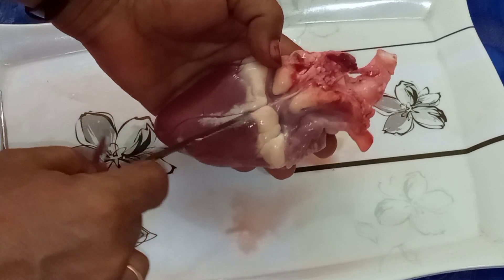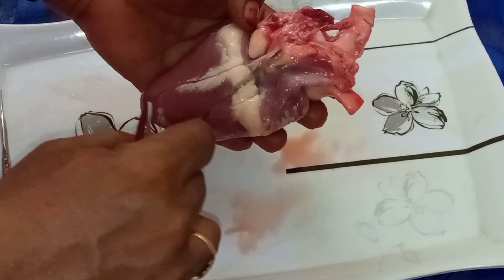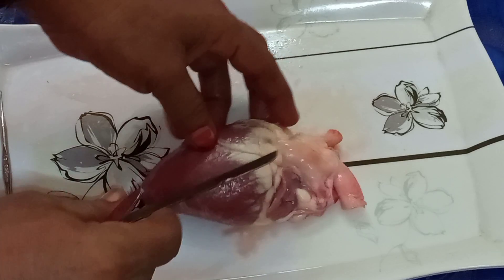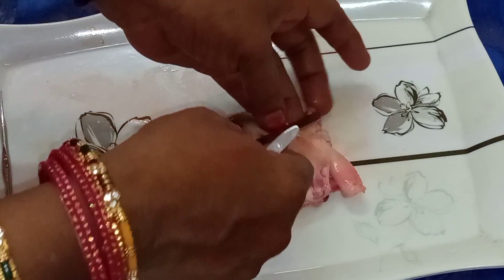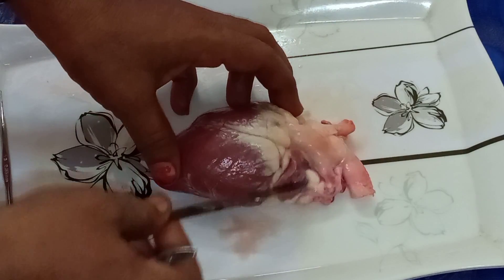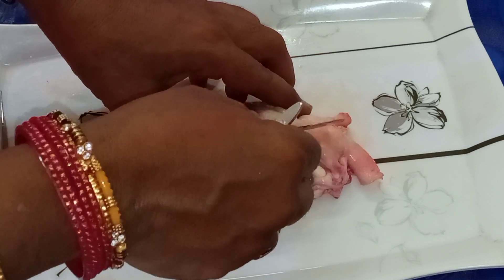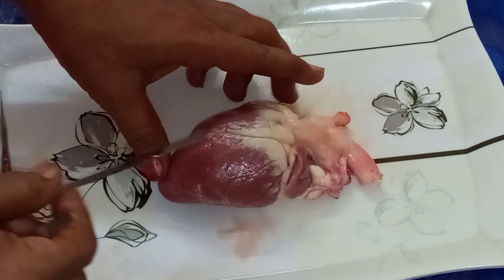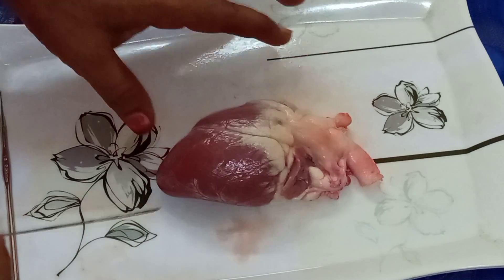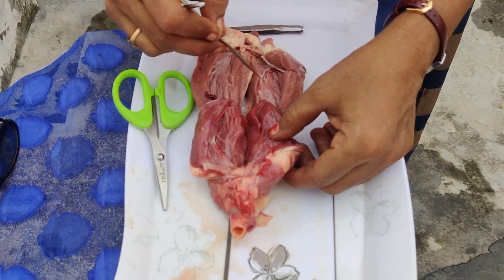See some grooves here — these grooves separate the heart into chambers. These are the blood vessels. This is the pulmonary artery, and this is the aorta. There are four chambers in the heart.